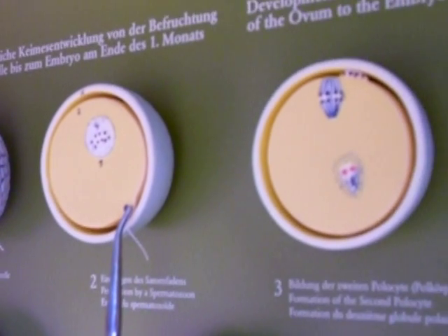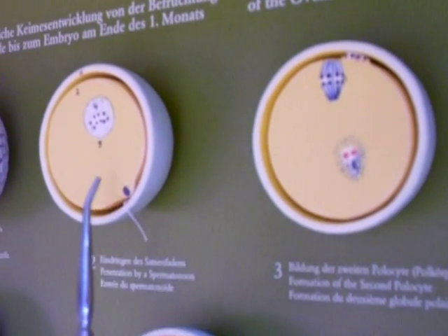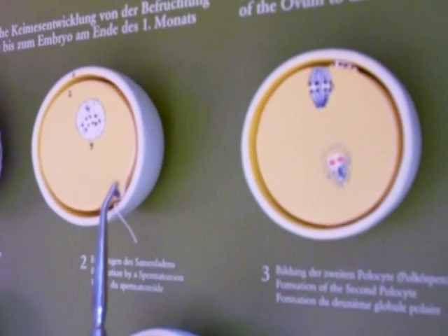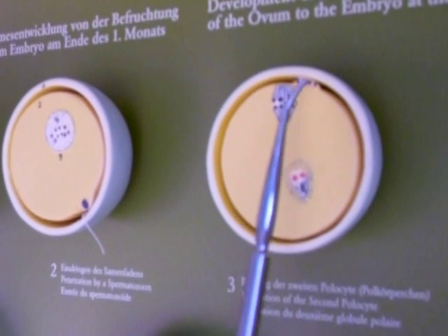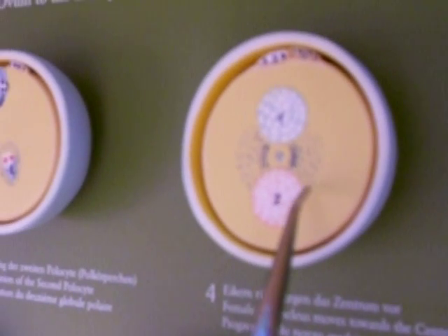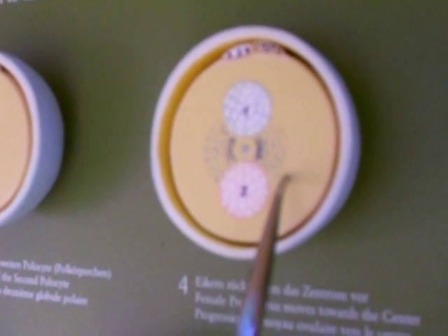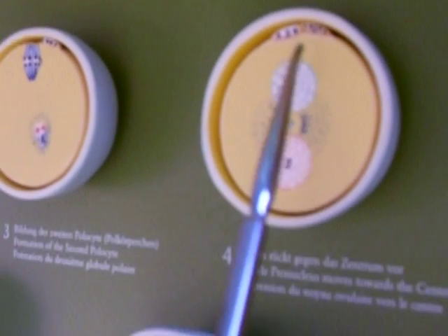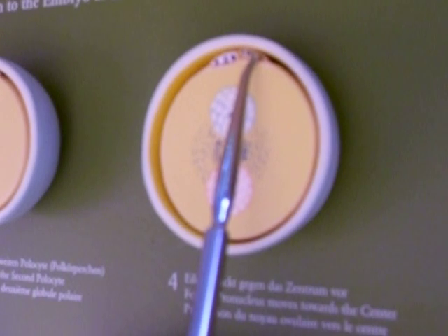These two represent when fertilization takes place, the sperm penetrating the egg will initiate the second meiotic division. And you can even see here the metaphase of meiosis II. You can even see a polar body right here. In this one, it represents, I believe, the mother and father pronuclei that will merge together and all of the genetic information will combine. You can see that the polar body underwent the second meiotic division as well.